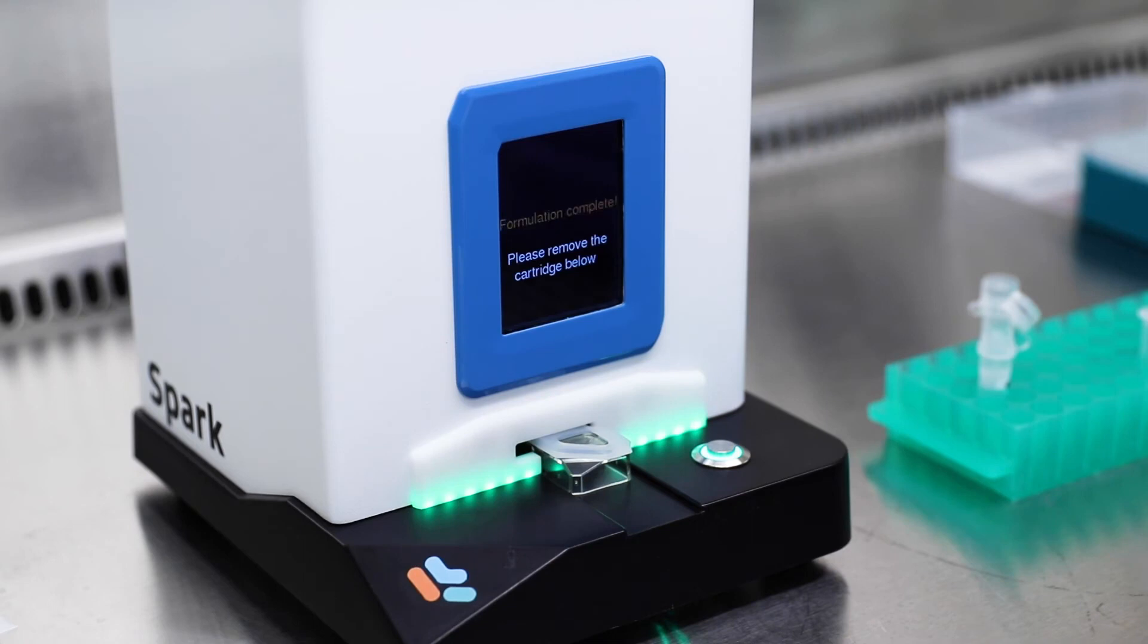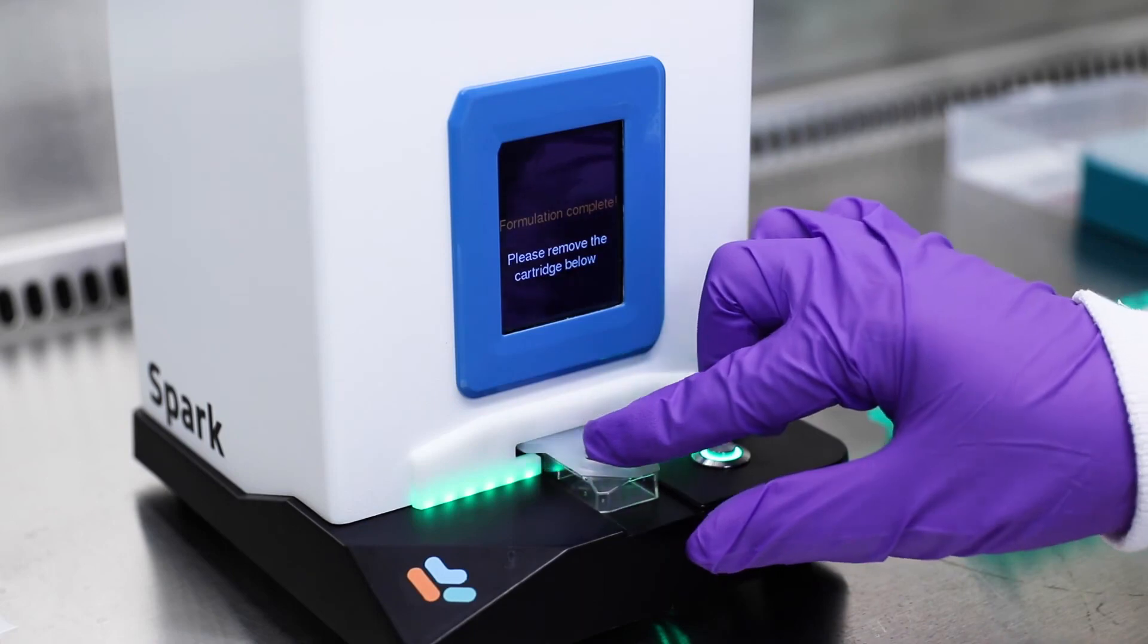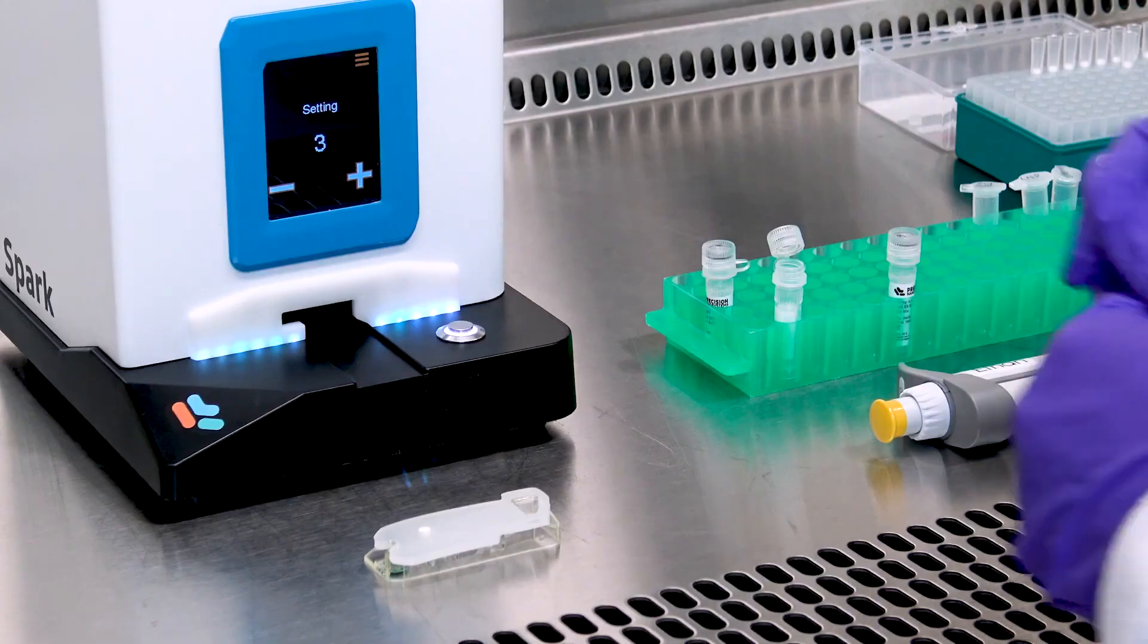When the formulation is done, the Spark screen will indicate the completion of the formulation. Remove the cartridge from the Spark. Remove the cap.